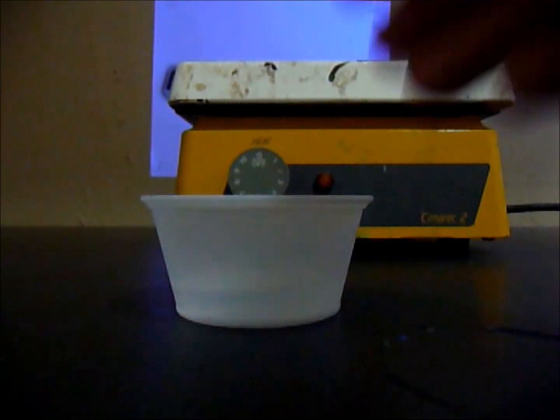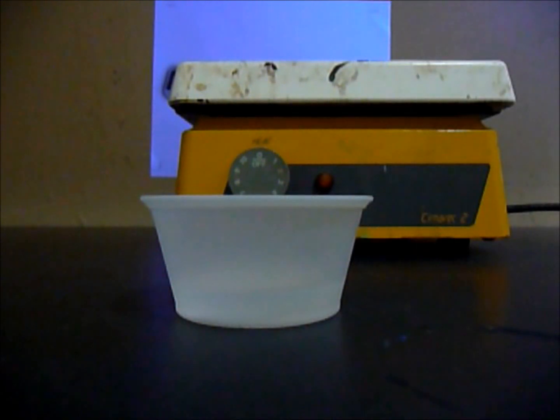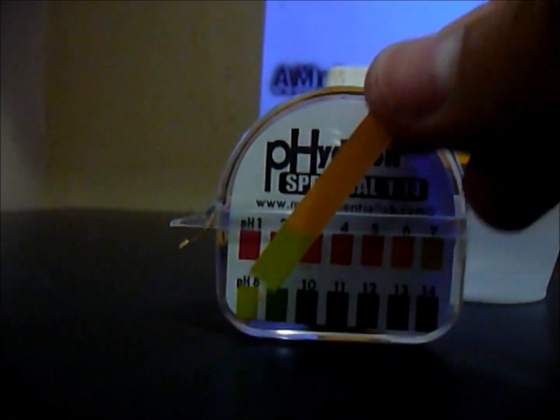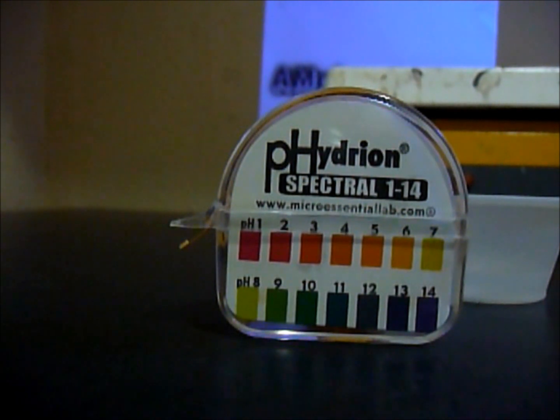To test if you make sodium carbonate, the pH has to be high. And this is just sodium bicarbonate. The pH is really basic, which is a pH of 8, which is a little bit of base.